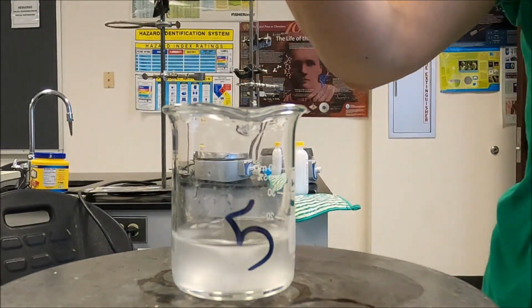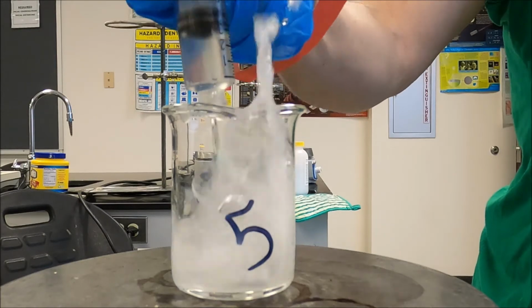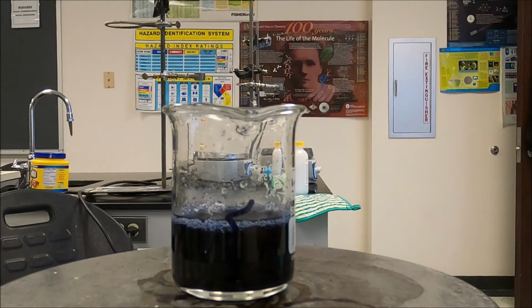Okay, guys, get on your mark, get set, go. Ooh, okay.